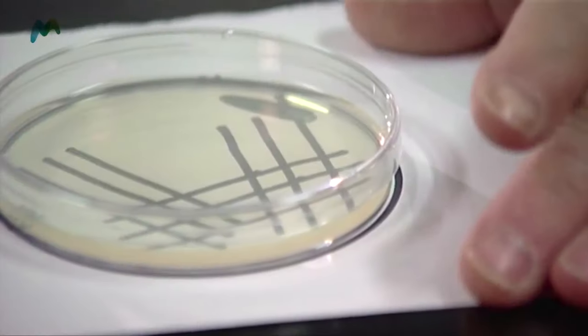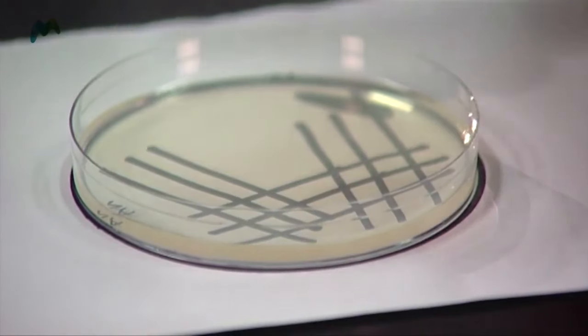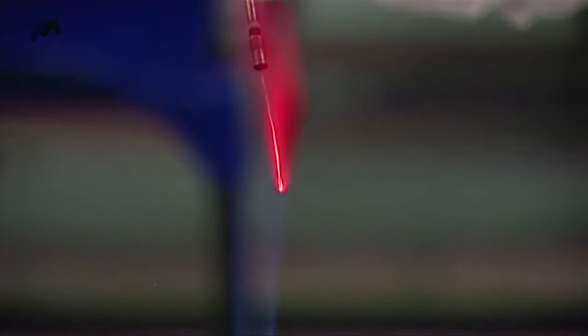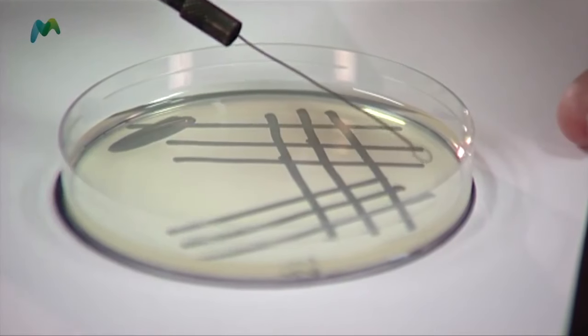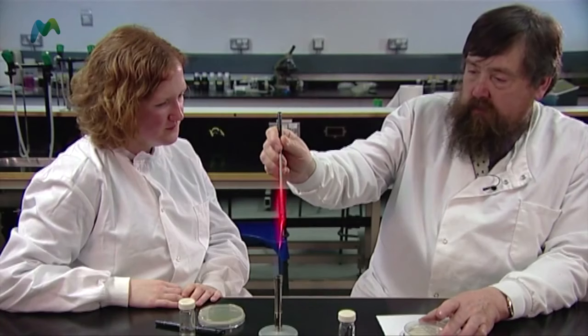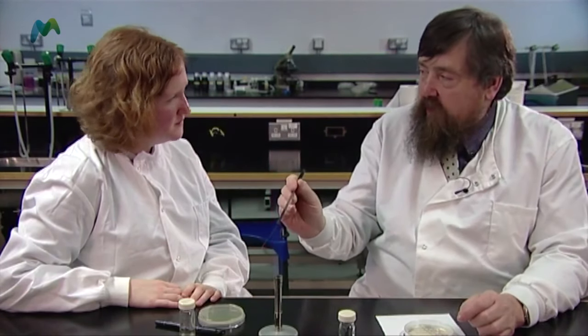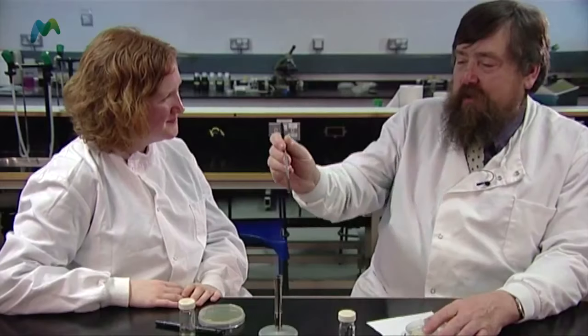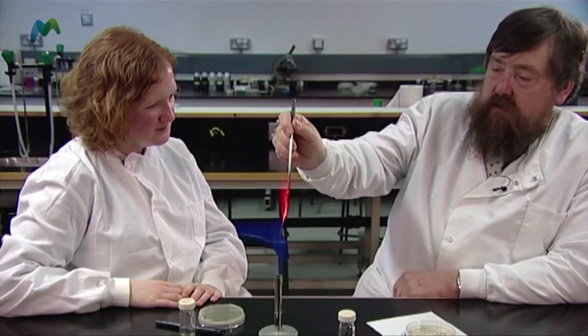Of course the loop will be too hot to use, so I wait for it to cool and turn the plate. If I think it's still too hot, I just touch it where I know nothing's going to grow — if it's too hot I get a nice hiss, but the heat goes into an empty area. Then I draw across one, two, three lines, sterilize the loop, wait again, check it's not too hot, and go one, two, three for the final pass. I finish with a flourish, sterilize the loop to ensure no culture is left on the wire, and put it down.